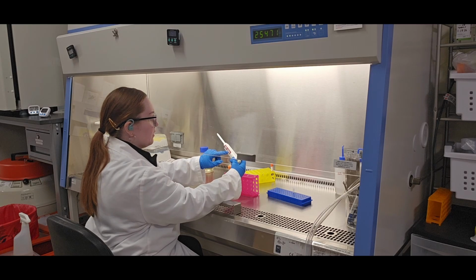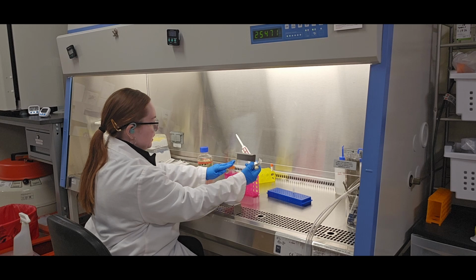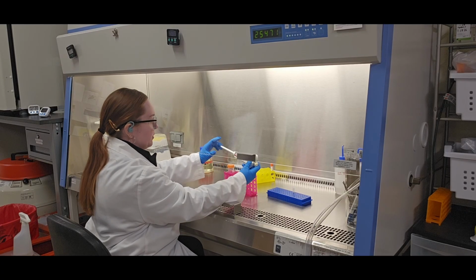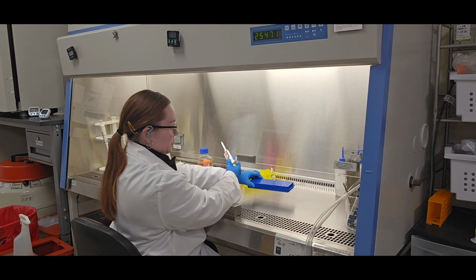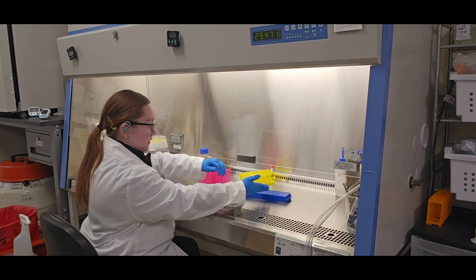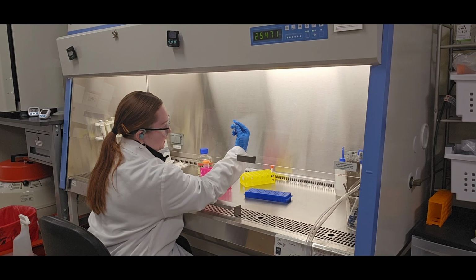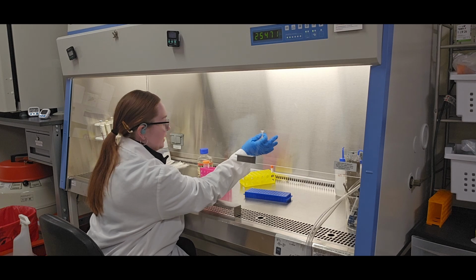This is small enough so that you're not disrupting the total volume of your cell suspension. You don't want to sample half of it out, that's way too much and you've lost a bulk of your cells. So just 100 microliters, and you put it into a sterile microtube here. I've taken out one and put it in a tube rack. Autoclaved microtubes are kept in the biological safety cabinet. So in here is my 100 microliter sample.